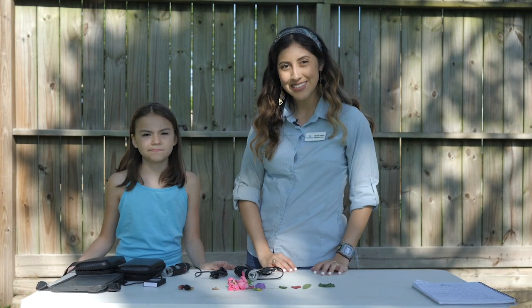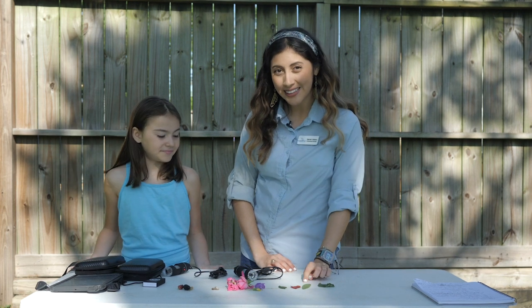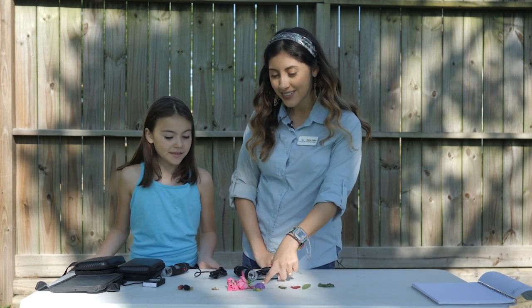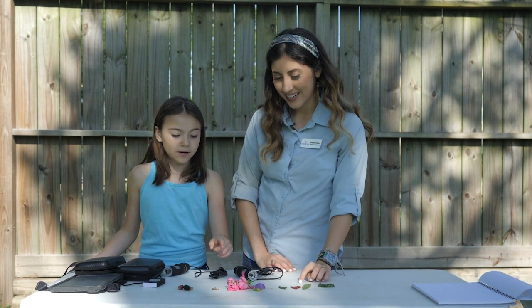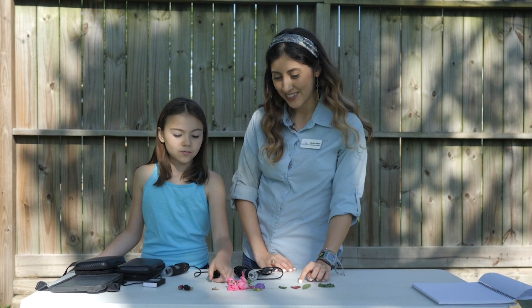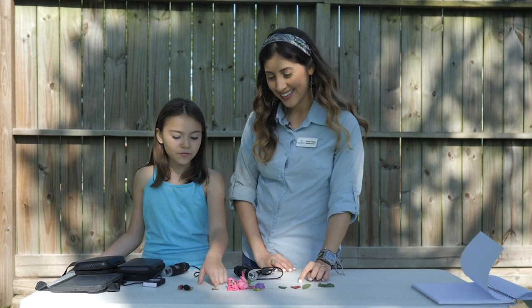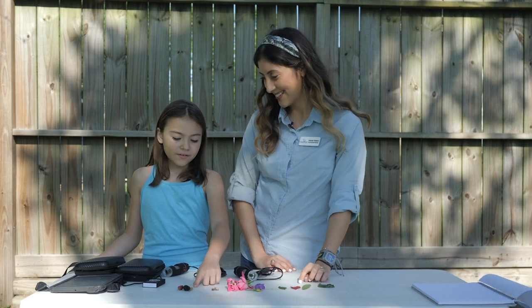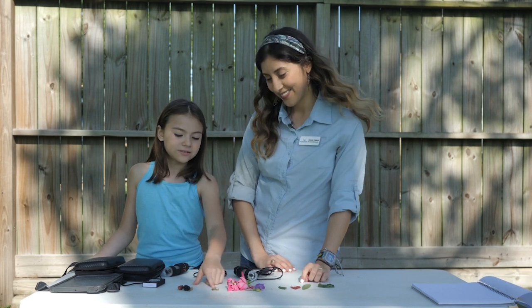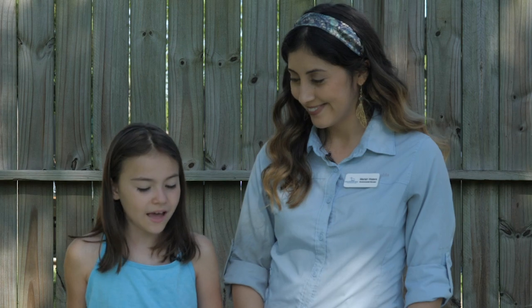Alright, so we found various types of leaves and flowers, and we found a caterpillar on one of them. And for the rest of the stuff we have berries and snails. So now we're going to take a closer look with the mini microscopes.